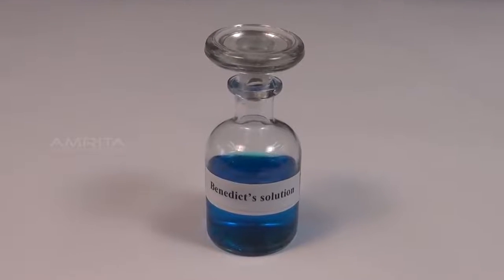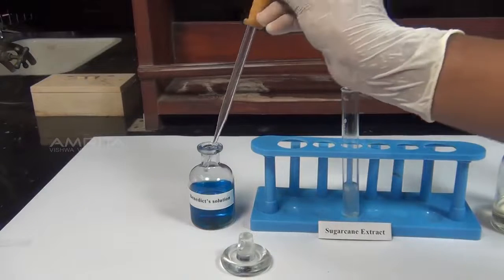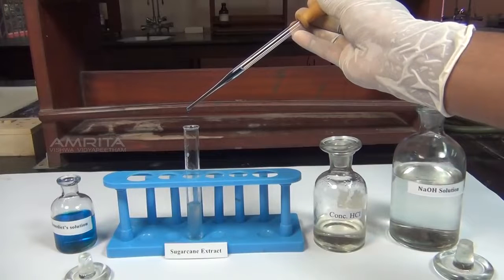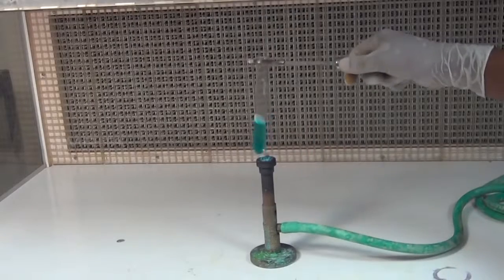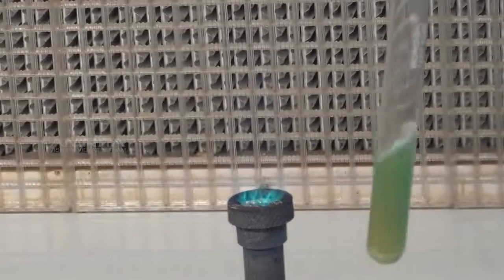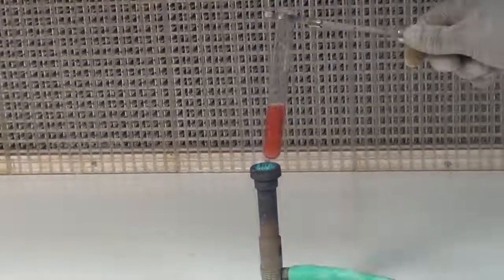Now, we can perform Benedict's test on this solution to test for the presence of glucose. Using a dropper, take a small quantity of Benedict's reagent. Add the reagent to the test tube containing the sample. Boil the sample over a burner for 2 minutes, holding the test tube firmly with the test tube holder. The color changes from blue to green and finally to orange or brick red, indicating the presence of glucose.